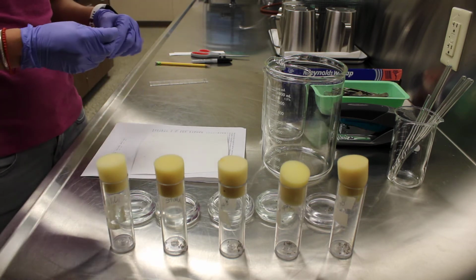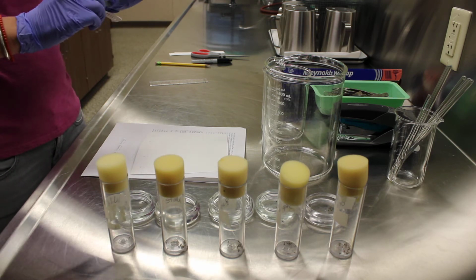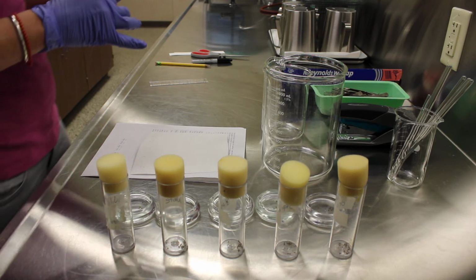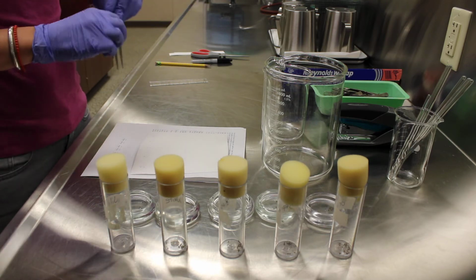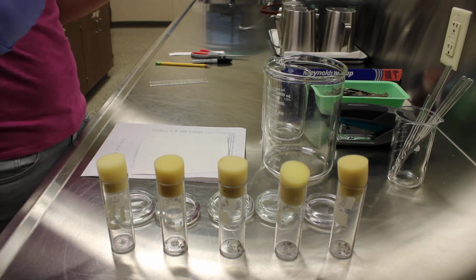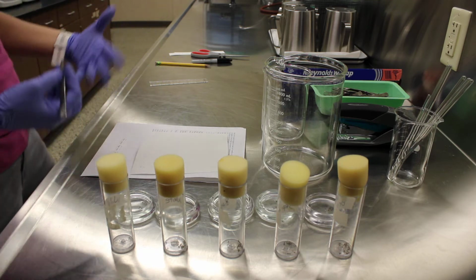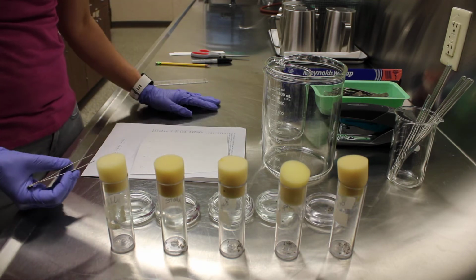Remember we talked about Thomas Hunt Morgan. He was the famous geneticist who studied fruit flies. These mutants were super important to his research, and today in this activity we're going to use these mutants to try to understand something about the relationship between proteins and phenotypes. And the proteins that we're going to be looking at are these pigment molecules.